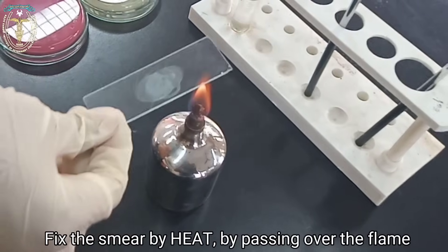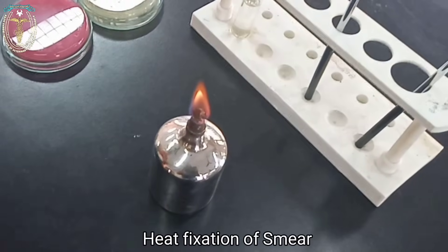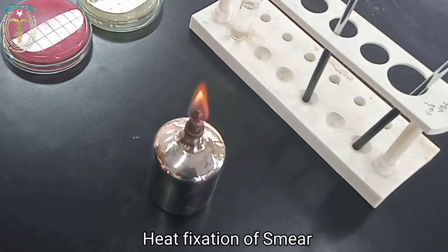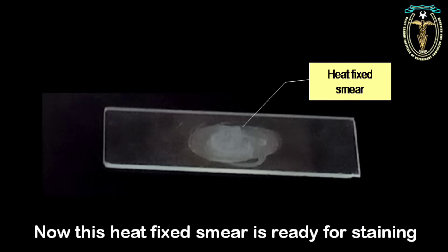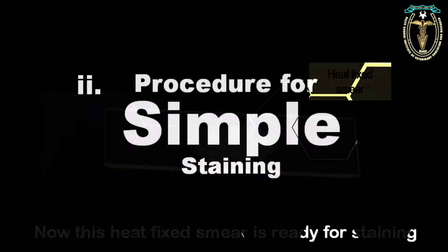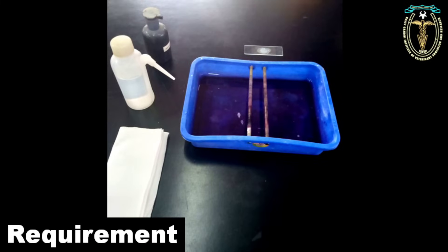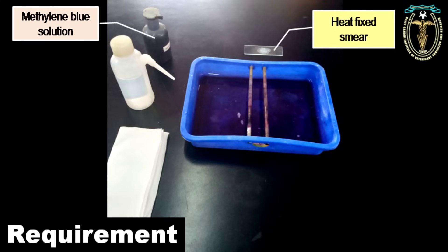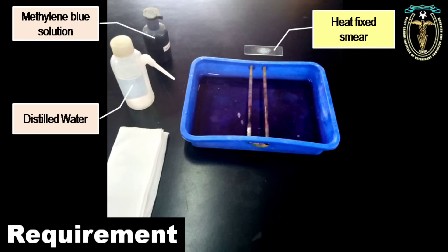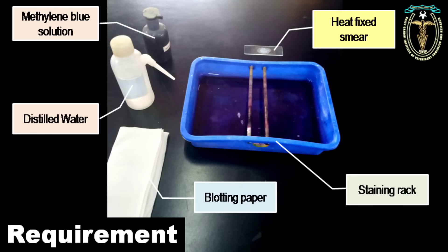After air drying, fix the smear by heat by passing it over the flame two to three times with a slow sweeping motion. This is called heat fixation of the smear. Now this heat-fixed smear is ready for staining. Next, the procedure for the simple staining technique. The materials required are the heat-fixed smear, methylene blue staining solution, distilled water, blotting paper, and the staining rack.